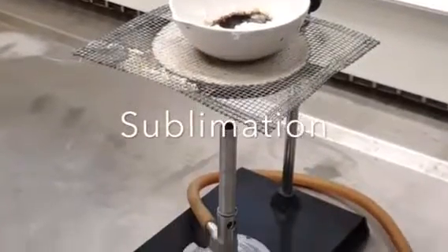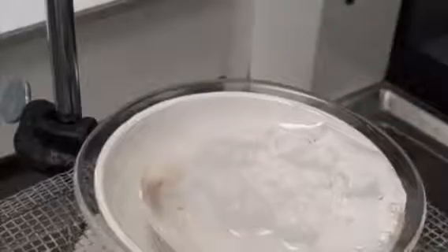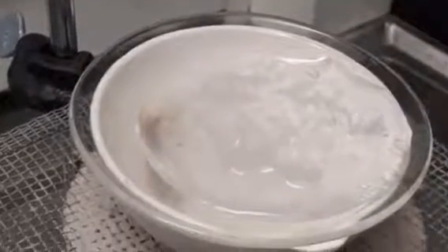Place a small amount of the solid in a porcelain capsule, covered with a watch glass that contains ice on it, and heat it. After a while, you will see the separation of the substance under the watch glass.